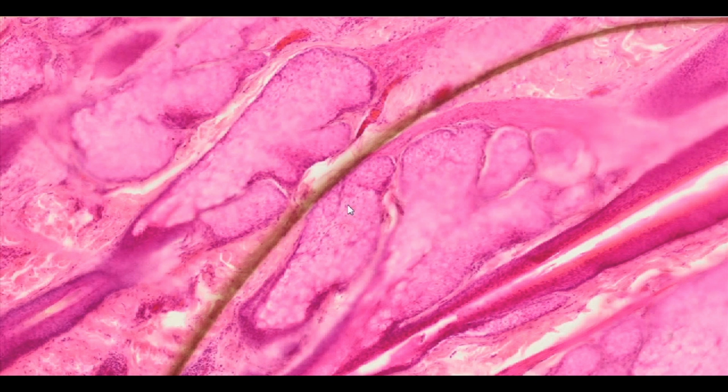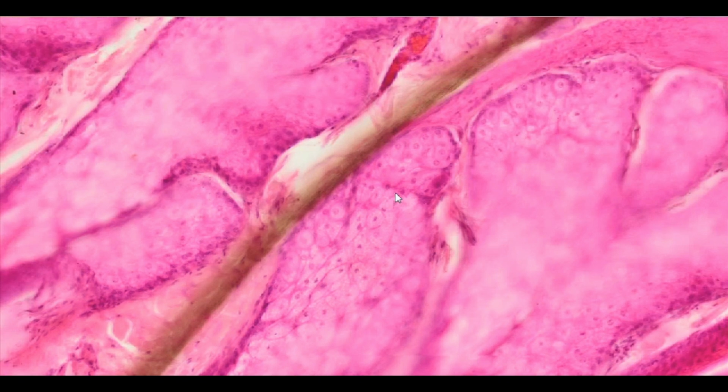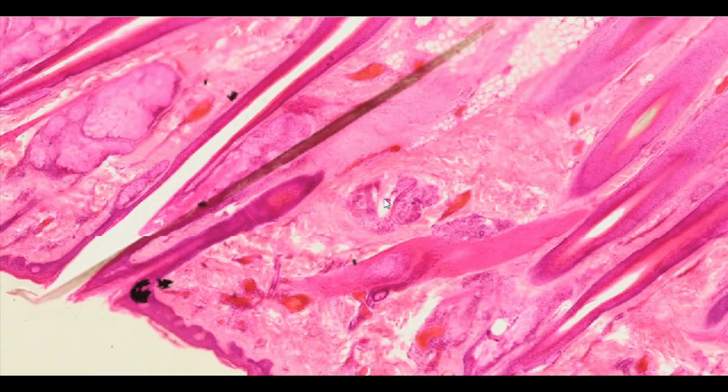The inside of the gland is filled with lipid-storing cells, which undergo apoptosis and become the secretion of the gland. Peripheral stem cells enable the regeneration of the gland. The bottom of the gland is surrounded by smooth muscle tissue, which gives rise to the erector pili muscle, whose contraction enables sebum secretion.